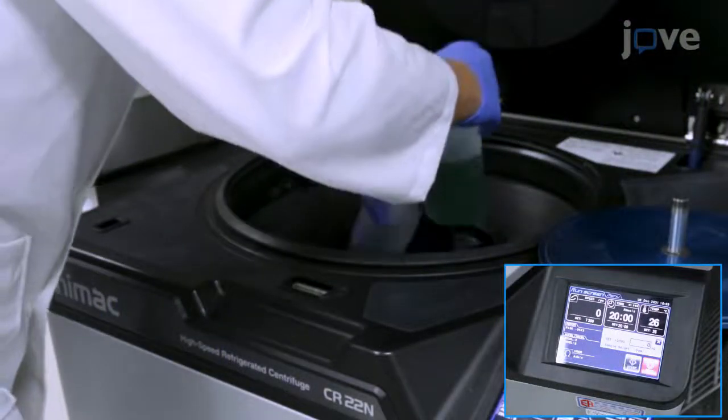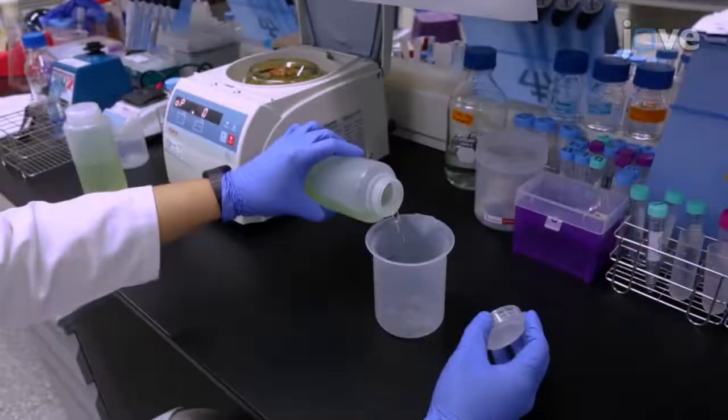Centrifuge the culture at a speed of 10,000 times G for 20 minutes at room temperature and discard the supernatant.